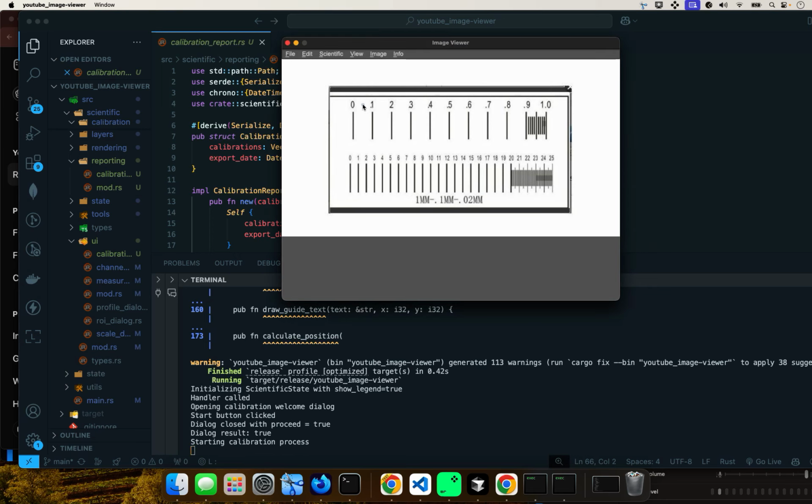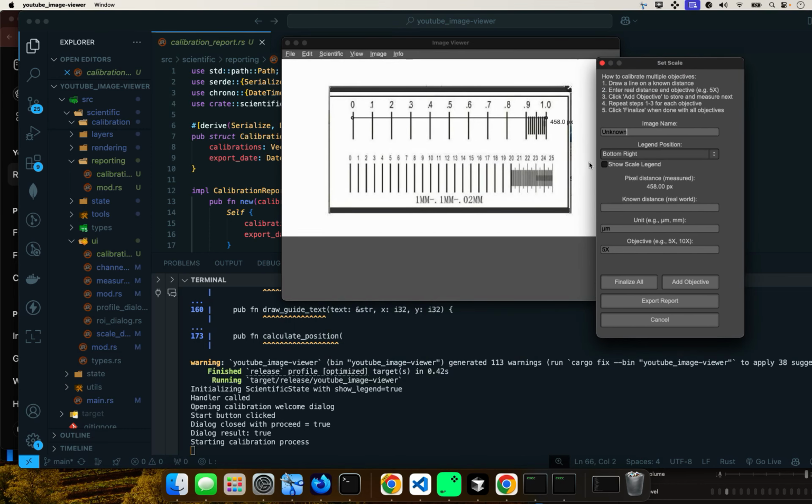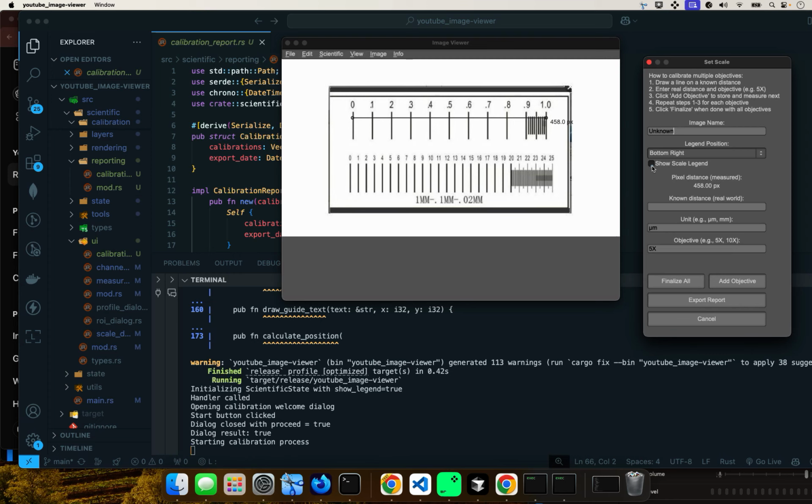In this case, we have this stage micrometer, so let's do the best we can here, because normally you would have a zoom to zoom in on the line. I haven't added it yet, but now it's more intuitive. You can put the image naming here. You can show the scale legend just like we did before. You see the legend there.